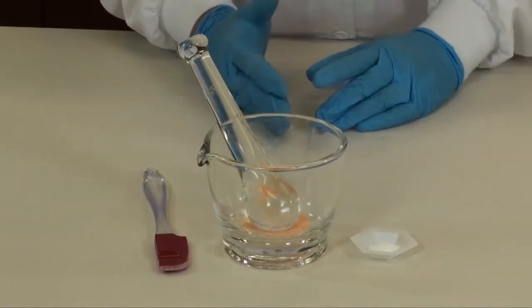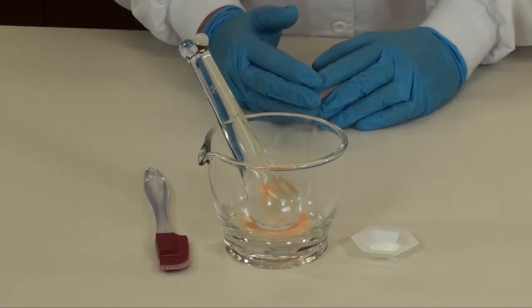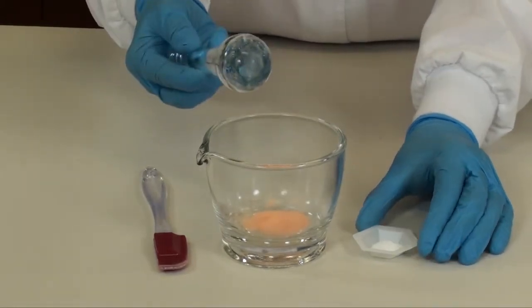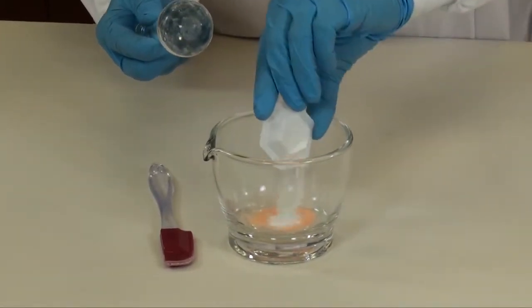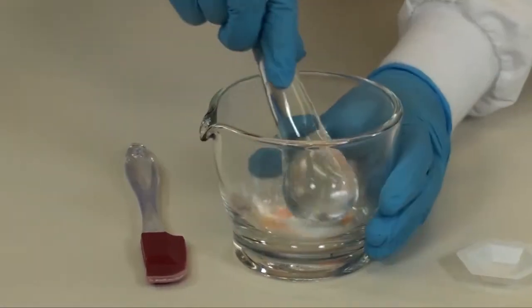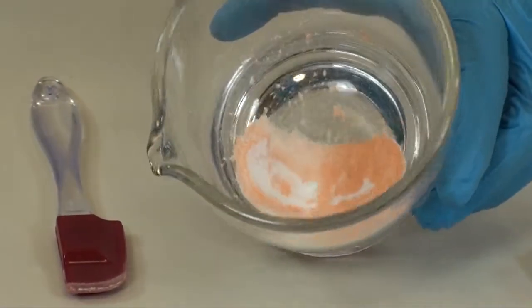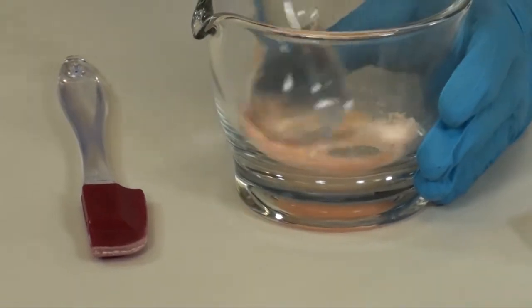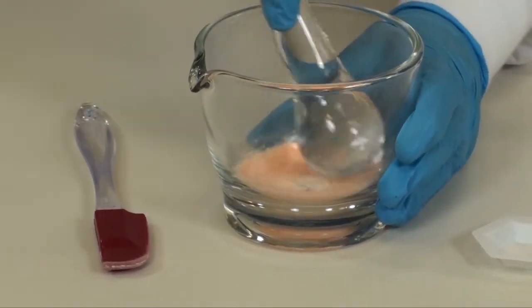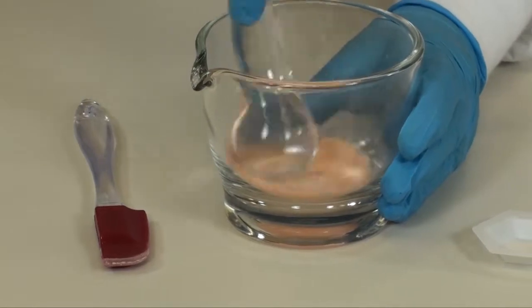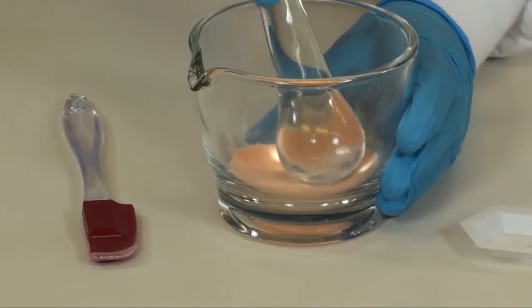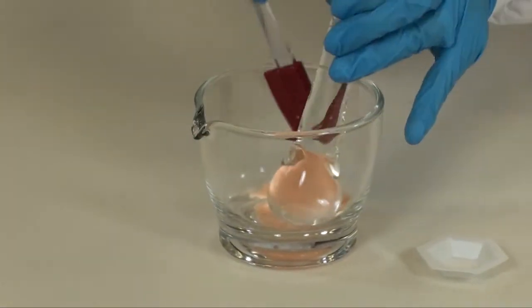There is no need to add additional food coloring since the propranolol tablets are already colored orange. Add the hydrochlorothiazide powder to the propranolol triturated powder and triturate until uniform. Continue to triturate until you have no white streaks and the powder color is uniform throughout. If you need to scrape the powder down, use your rubber spatula.